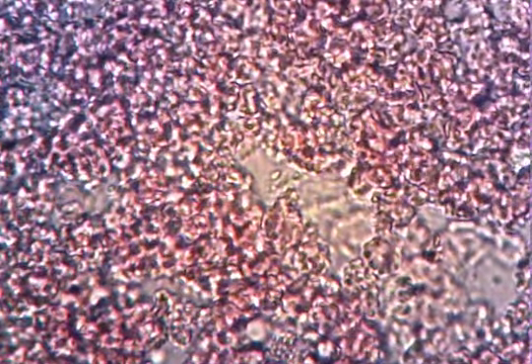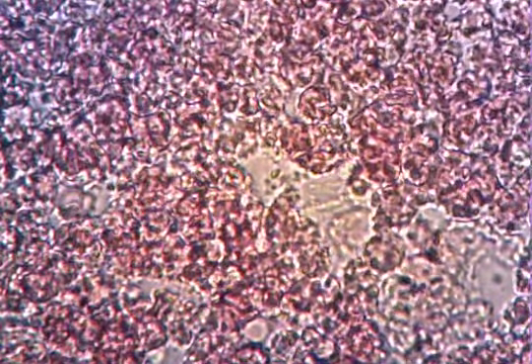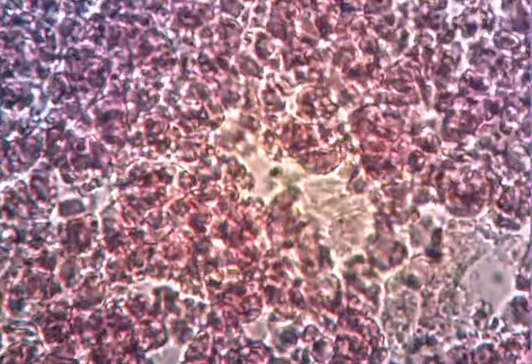Now, what's interesting on this one, do we see the same columns that we saw in the last one before we did anything with it? No, we don't. It looks like... Now, it could be just because it does kind of look like spaghetti. It's a good description.